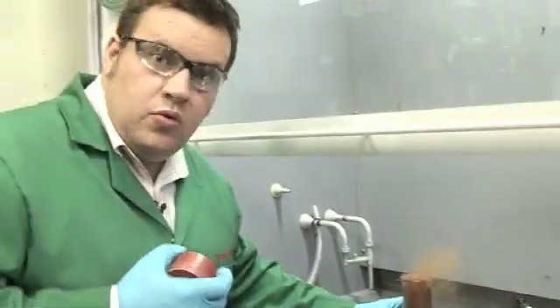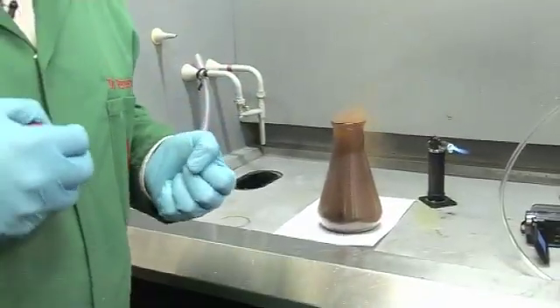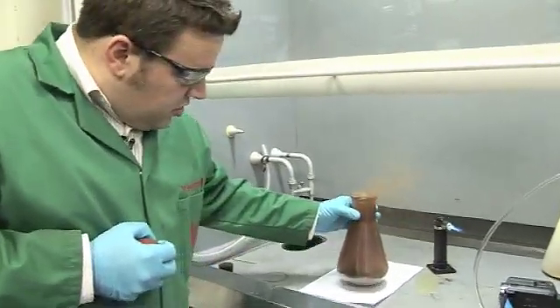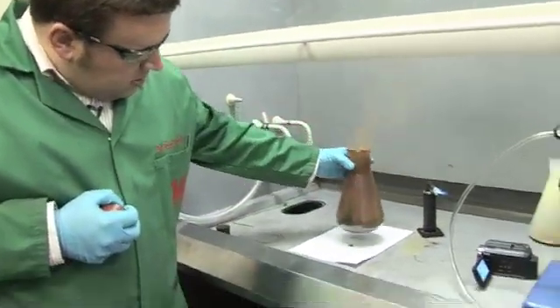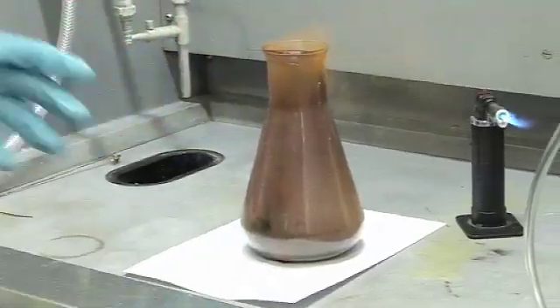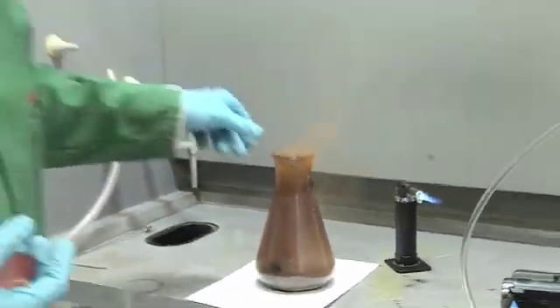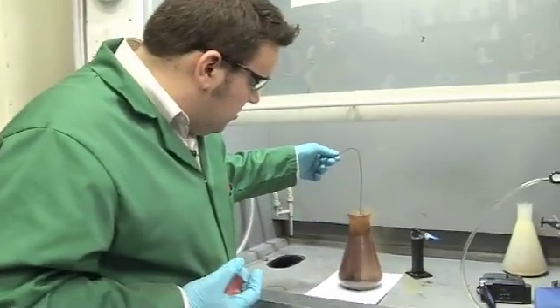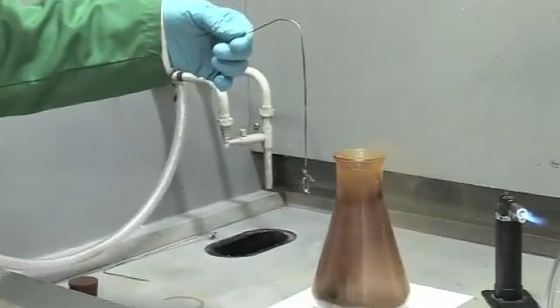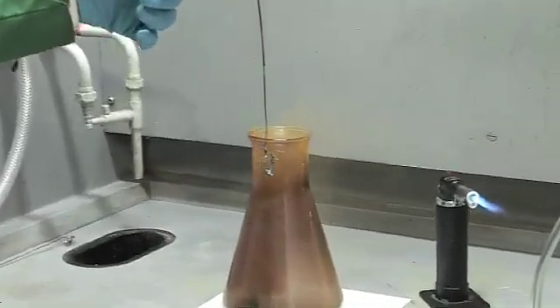Well, it's warm. It's not too hot to touch. It's like picking up a mug of warm tea or warm coffee. But you can see, again, the products of the chemical reaction are precipitated out across the flask. And now if I remove the wire again, I can see that all of the iron has been consumed instantly. The moment that it got into that chlorine-rich flask.